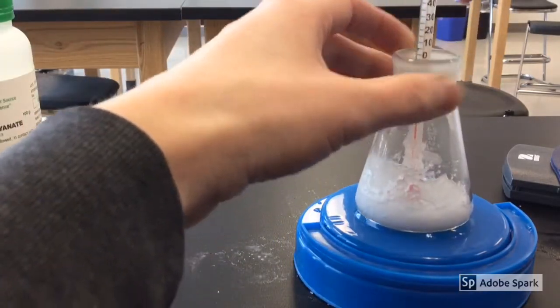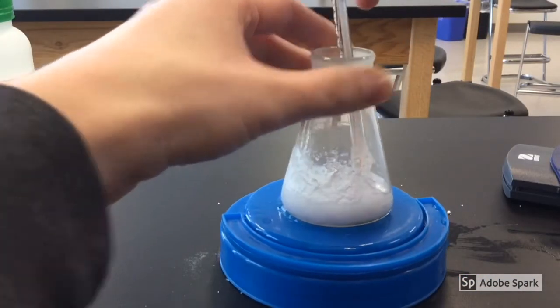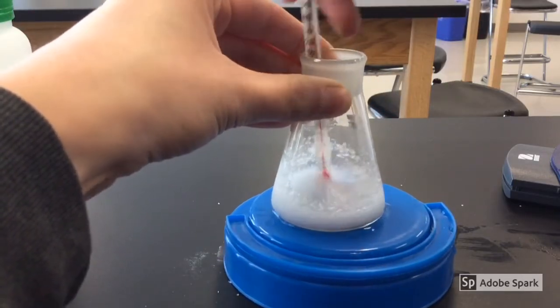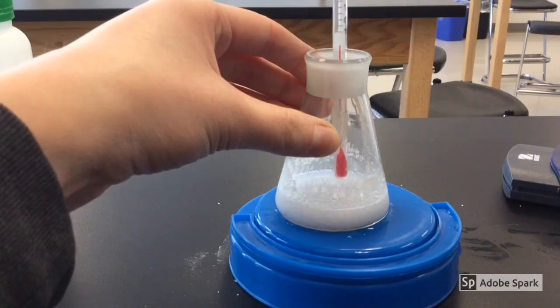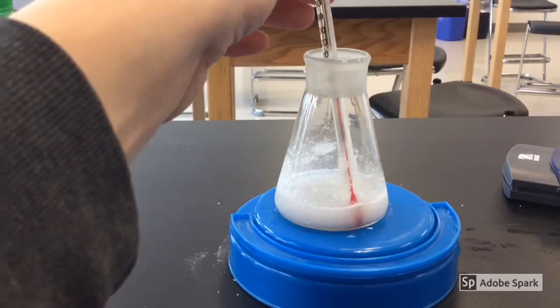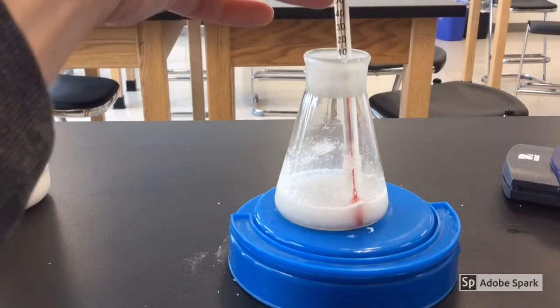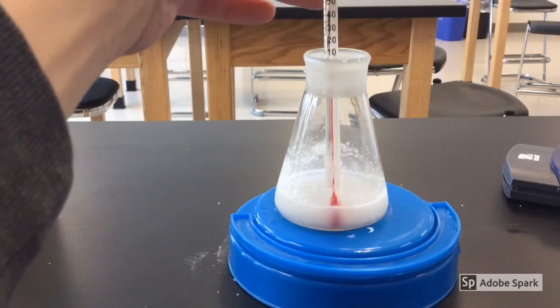I'm actually going to put this on top of my water. What we start to notice is that it turns into a liquid — it almost looks like a slushie. My temperature has dropped below negative 10 degrees Celsius, and it's just going to keep on dropping. If you remember, zero is freezing, so it's well below freezing. It's actually going to get to about negative 30 degrees Celsius — it's probably at about negative 20 degrees right now.